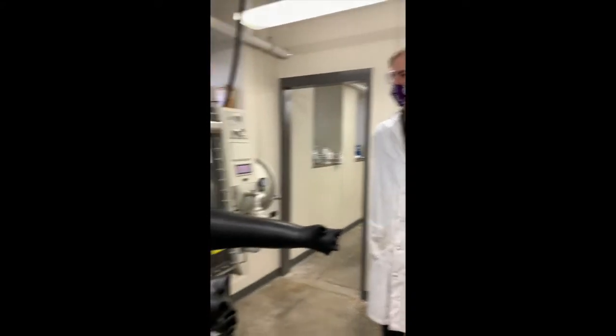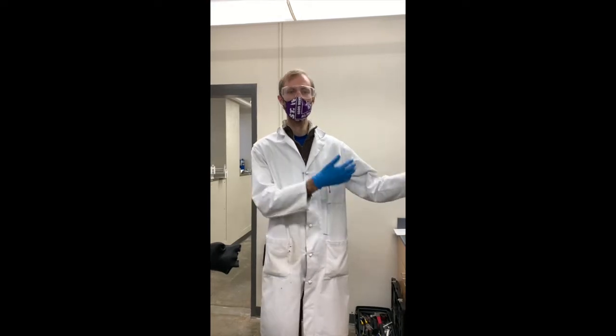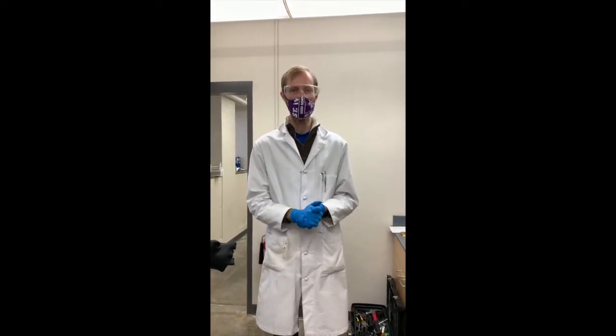Hello, my name is Sam and welcome to the Yume Group glove box training. Here is the glove box and what I would like to talk about right now is how to remove a reagent from the glove box for use in a reaction or whatever outside of the glove box.